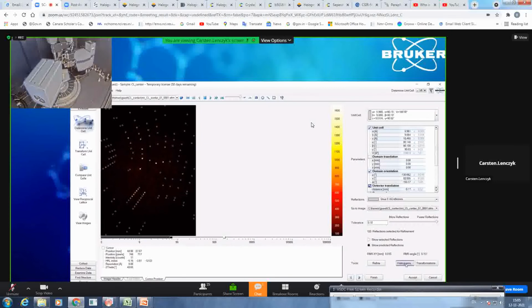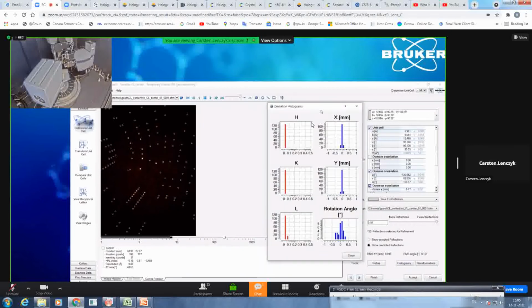If you are more into graphics, you can also check this histogram window, because what you see here is, again, this is the real space, this is the reciprocal space, and what you want to have is that for both, the maximum is as close as possible to 0. Because this means the reflex that you observe is where it should be, where the estimated position should be. So this is at 0, and you have little to nearly not existing signals close to 0. So this is very, very good.